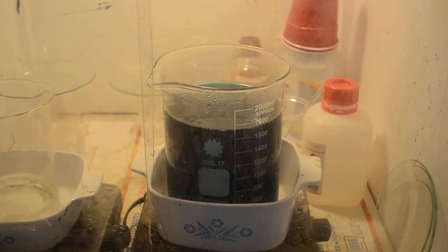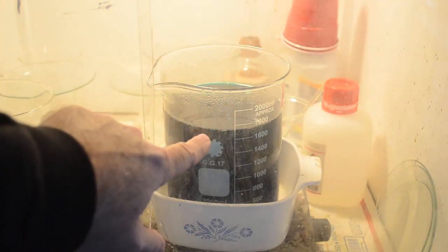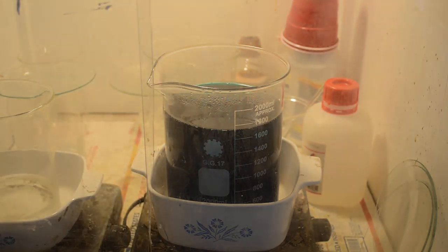I started this last night, and it was right at 2,000 milliliters, so we've already evaporated away over 200 milliliters of the liquid. My plan here is to reduce the volume by at least half or two-thirds, and then cool it and see what crystallizes out, collect those crystals, and maybe continue evaporating down whatever liquid's left. This is probably going to take a few more days. I'm just going to leave it on warm heat.